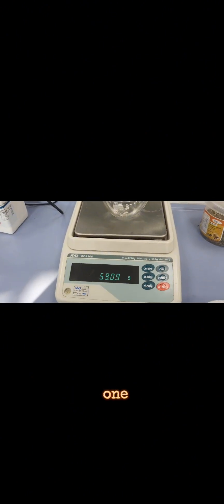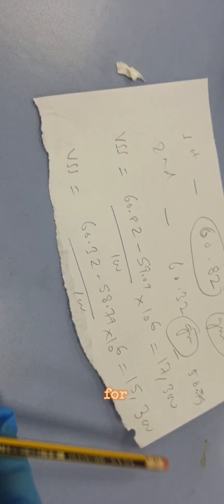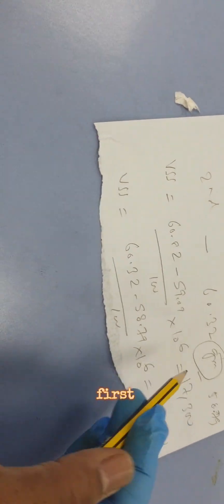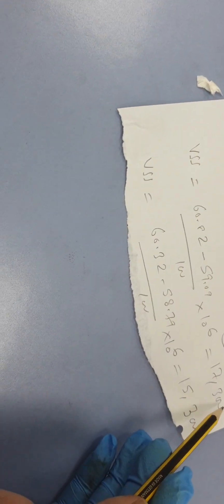Now we'll take this out and cool it and weigh. The weight of the first one is 59.09 grams, a significant drop. The second one is 58.79 grams.